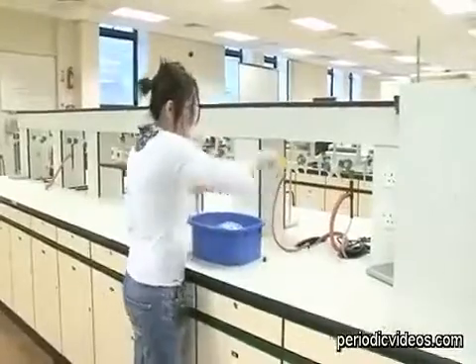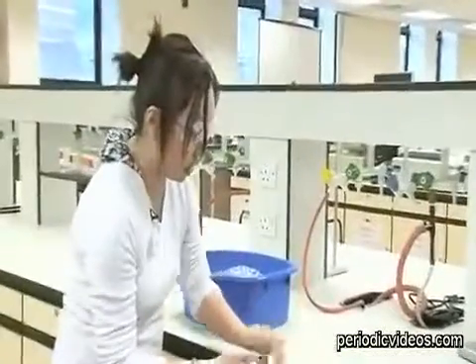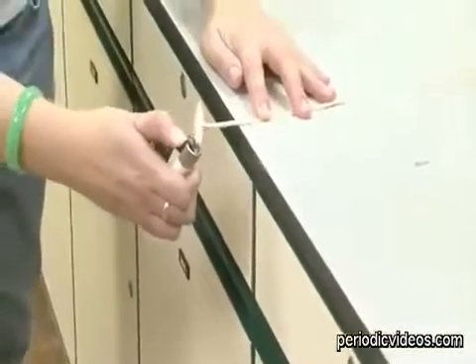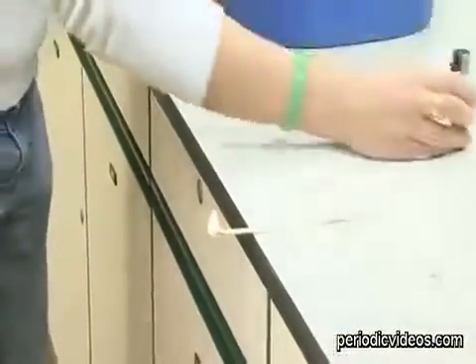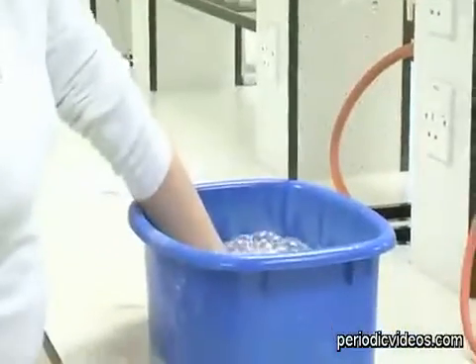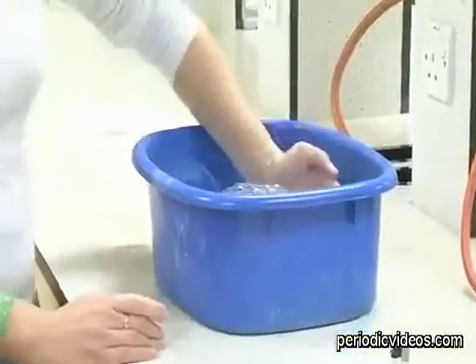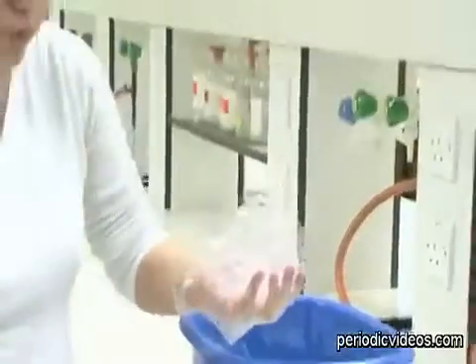And to prove it's methane and not just air that we're putting into it, I don't have a match on a stick like Pete does. So that I don't burn myself, I'm going to coat myself in some soapy water and then scoop up a handful of this.